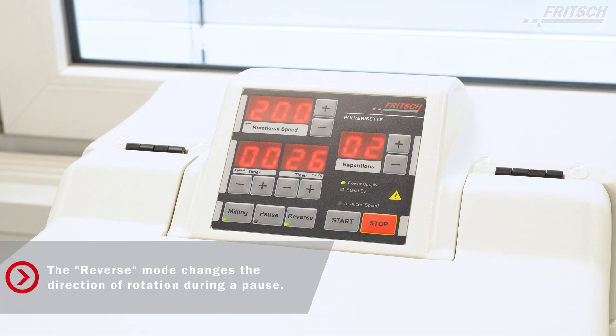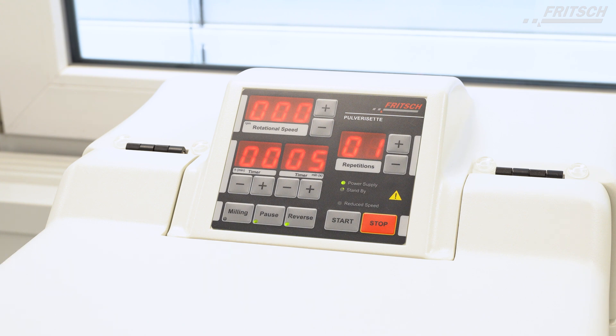The reverse mode is enabled, which means the instrument changes the direction of rotation during a pause. This is necessary to get the best result for the mixture.